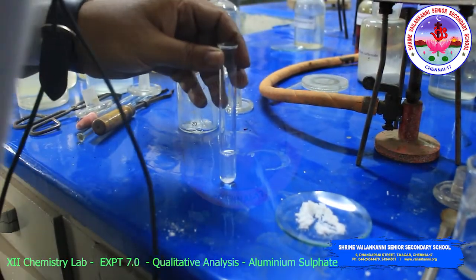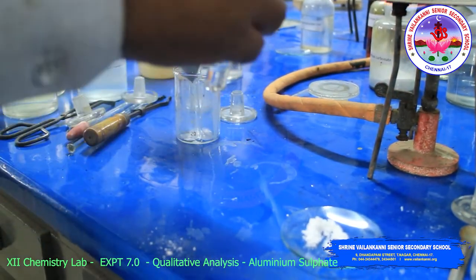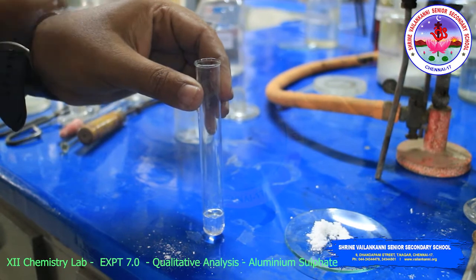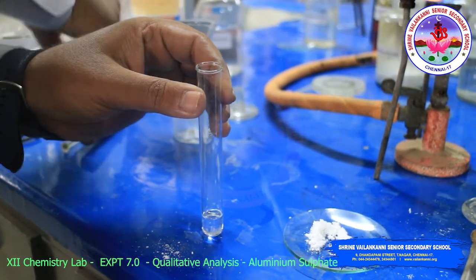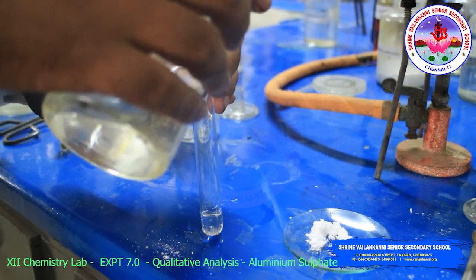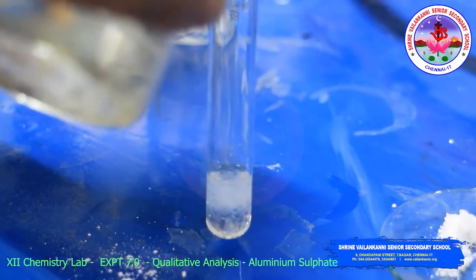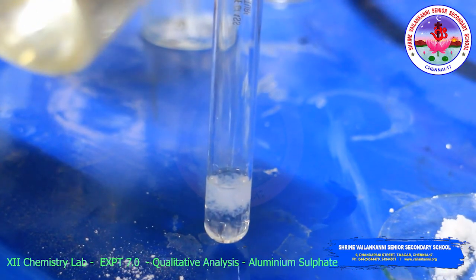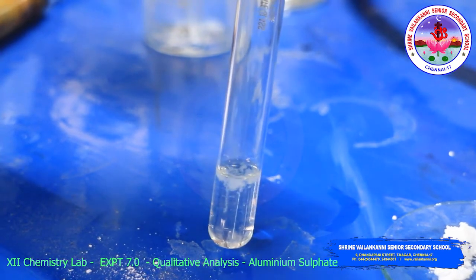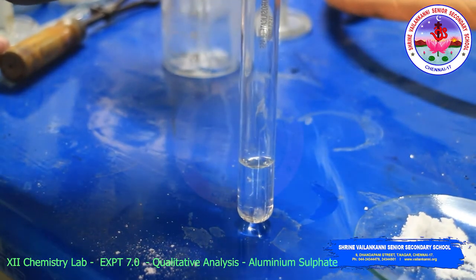Then take two parts. First we will do the sodium hydroxide test. To the original solution, add a small amount of sodium hydroxide solution. A white precipitate is obtained. On adding excess sodium hydroxide, the white precipitate dissolves. So this indicates aluminum is confirmed.